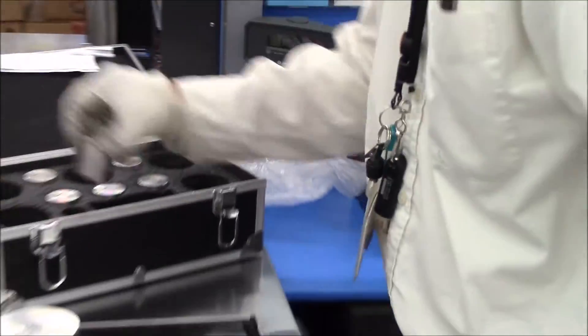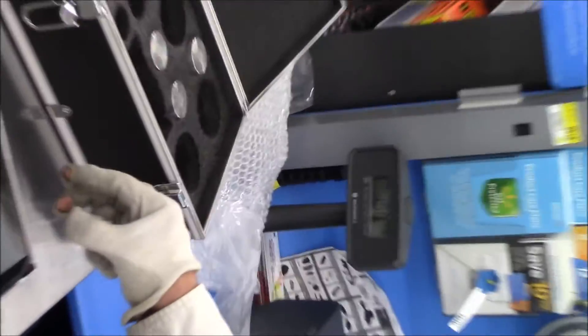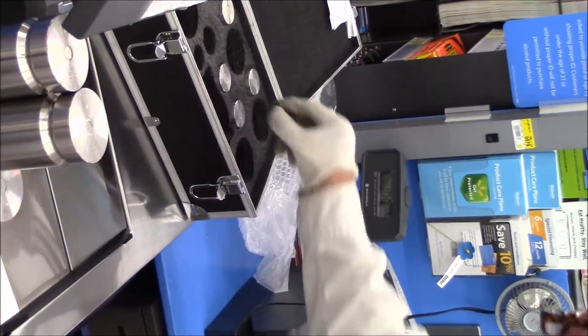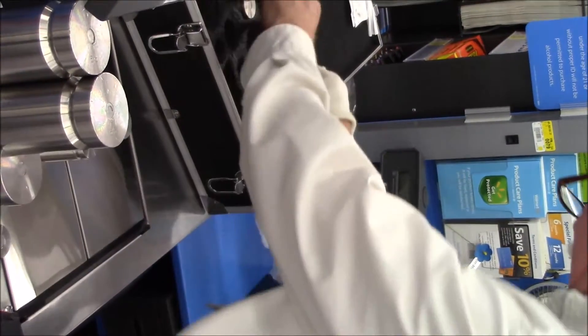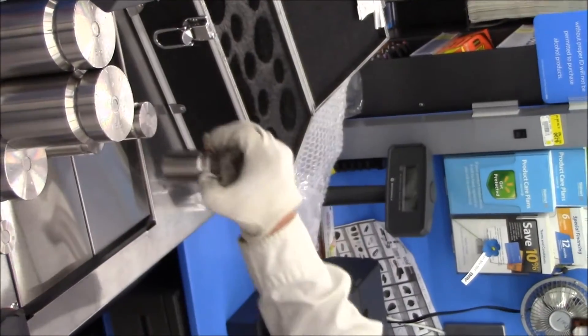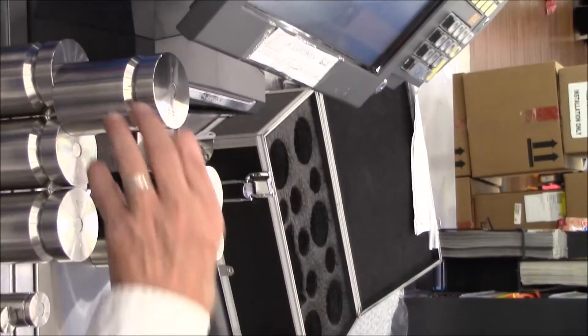I start with point two, then add point five. Take the point two off — I read point five. I put a one on there, it reads one point five. I take the point five off — it reads one, two, three, four, five. These have to be exact all the way up to ten.